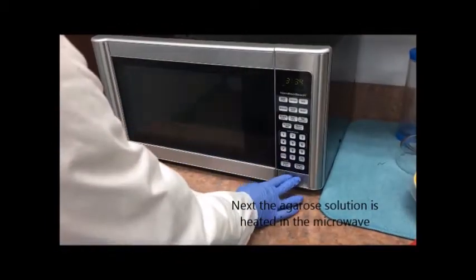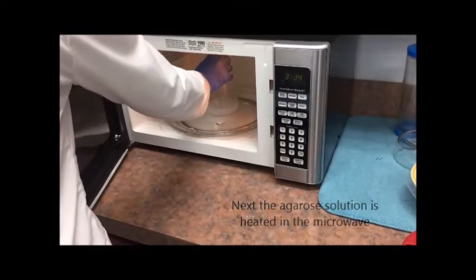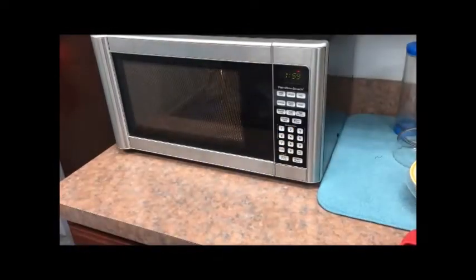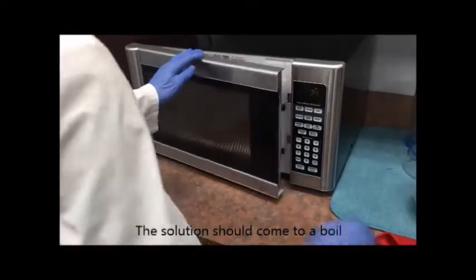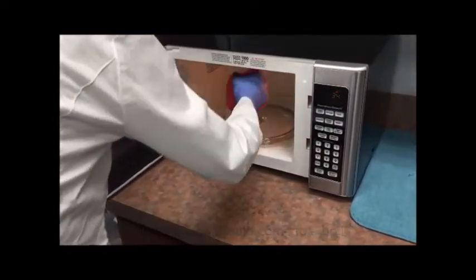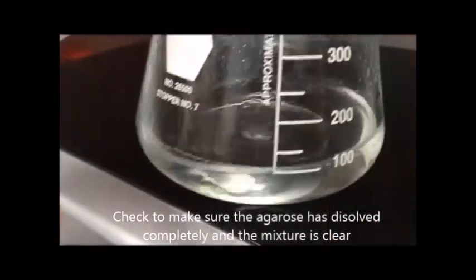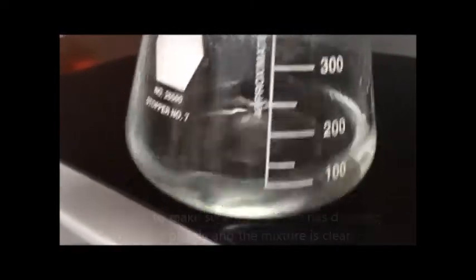Next, the agarose solution is going to be heated in the microwave. 1.5 to 2 minutes at maximum power is usually sufficient. Make sure the solution comes to a full boil and carefully remove the flask using your hot mitt. Check to make sure the agarose is dissolved completely and the liquid is perfectly clear.